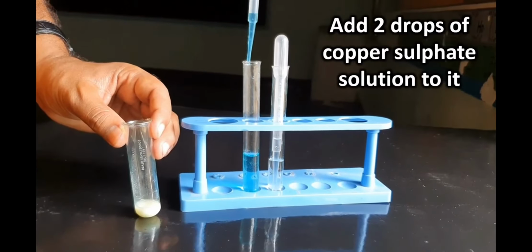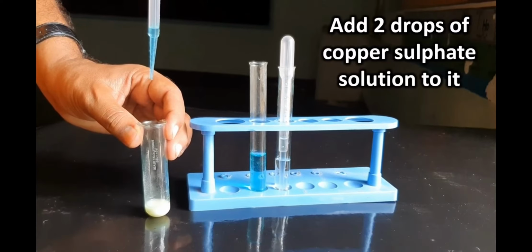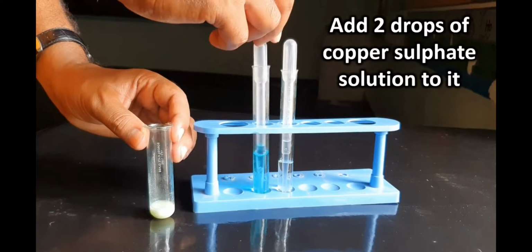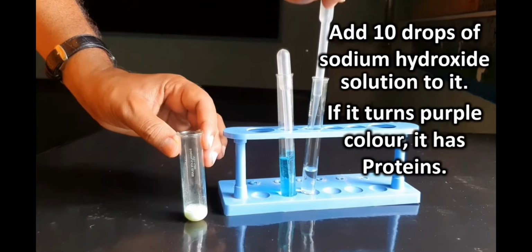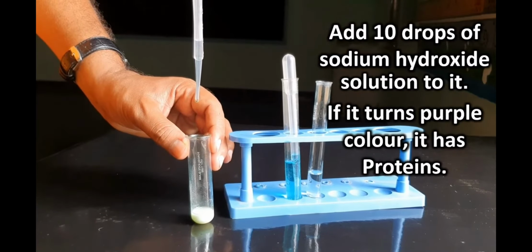Now we'll add 2 drops of copper sulfate solution and then we will add 10 drops of sodium hydroxide solution, drop by drop.